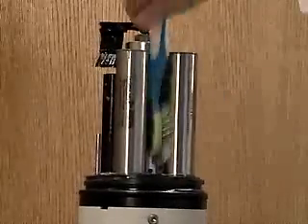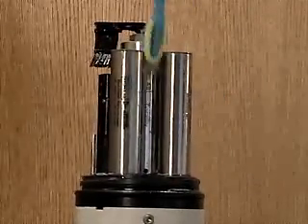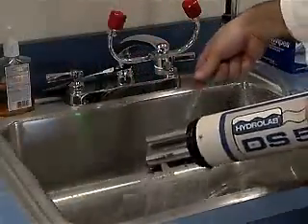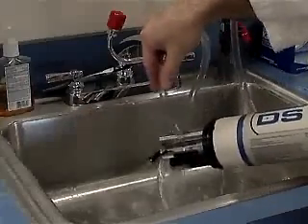Before and after each deployment, use a soft brush and mild soap to remove dirt and debris from all of the sensors. Rinse with clean, fresh water.